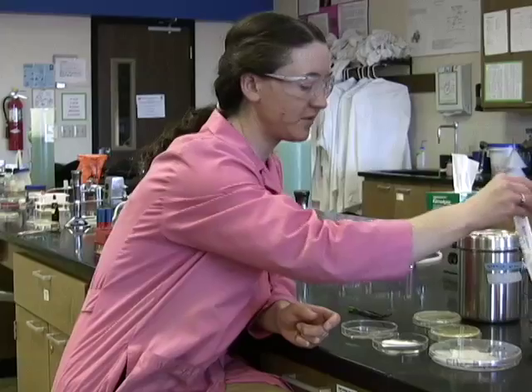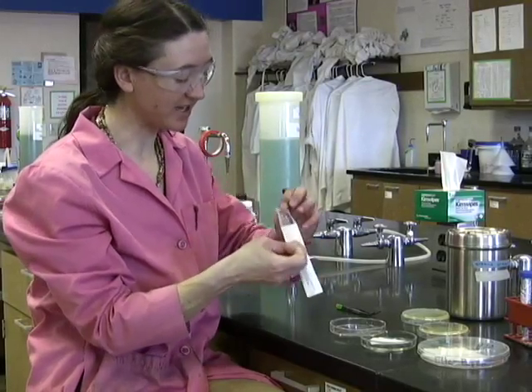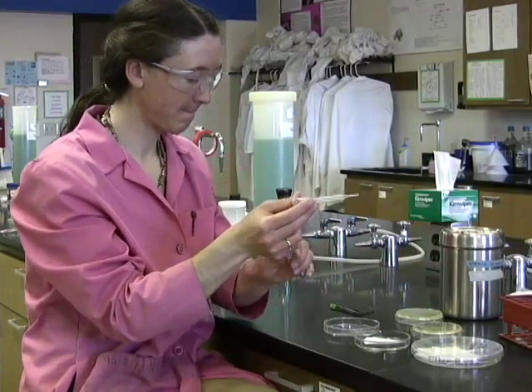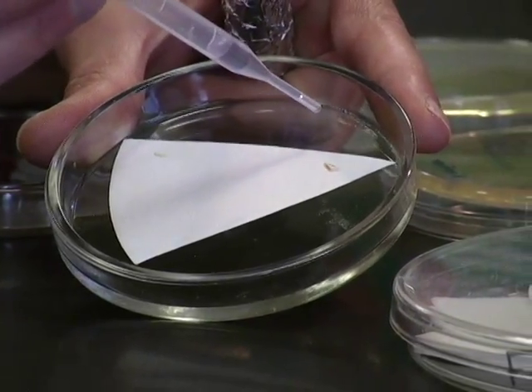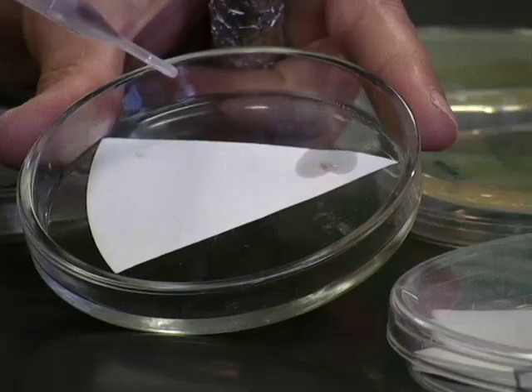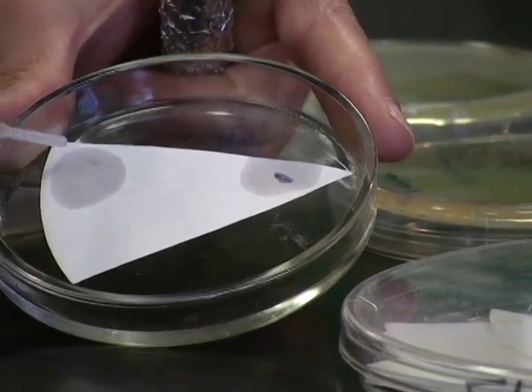Now we're going to add the oxidase reagent to both the Pseudomonas and the Shigella. The oxidase reagent is a chromogenic reagent that changes color upon oxidation. So you're just going to want to add a little drop on top of your positive, and within a few seconds after you add these drops, you're going to want to read the results. So add a drop onto your positive and your negative, and bingo. Look at the dark purple color change on the positive, and the negative just simply stays white.